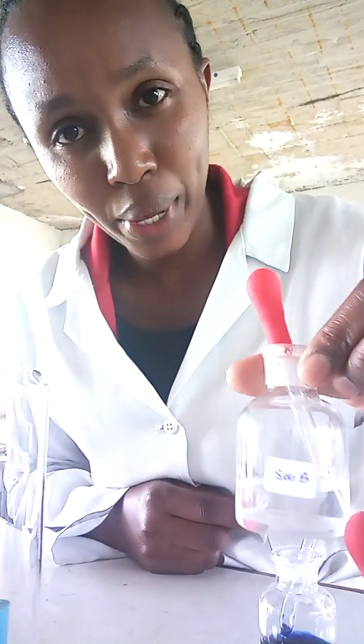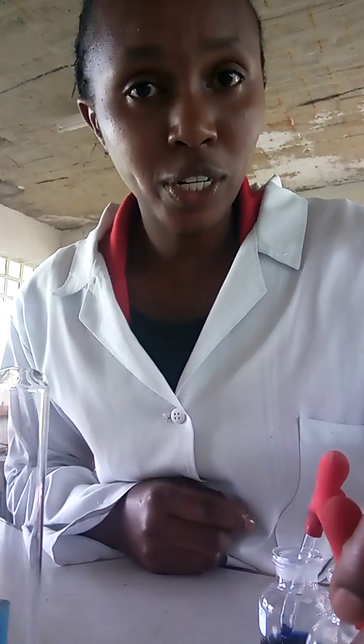Welcome to my biology practicals. We are dealing with food tests, and I want to show the test for ascorbic acid. Ascorbic acid is also called Vitamin C. To test for Vitamin C, the solution we use is DCPIP, which is blue in color. We have solution B and solution Y, and we want to know which one contains ascorbic acid.